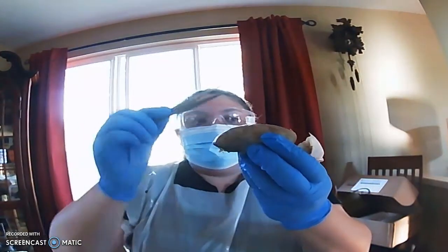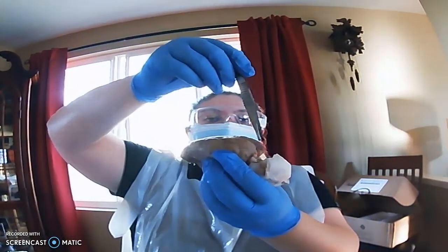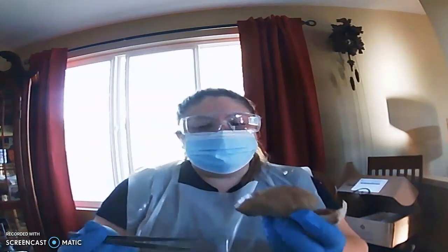As far as areas of the brain, this frontmost area, this is the frontal lobe. The middle here, except for the sides, more the top middle, that's the parietal lobes. And then back here you've got the occipital lobes. On either side, you've got the temporal lobes.